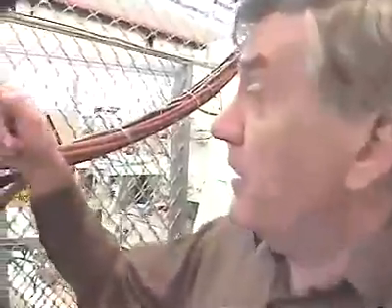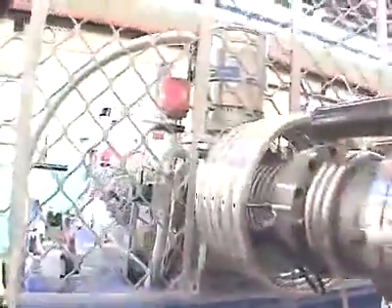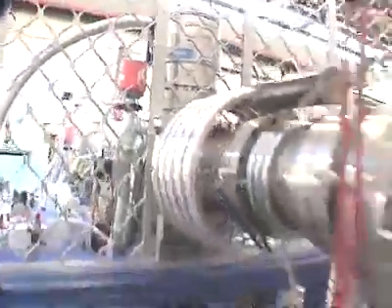We also need a very high vacuum in the tube from the ion source to the accelerator. There must be no air that can impede the passage of the atoms. So to do that, we have vacuum pumps around the system, and there is one at the top, that cylindrical object, which is making quite a loud noise, but it has to run 24 hours a day to keep the vacuum there. Now, let's go and have a look at where the atoms go.